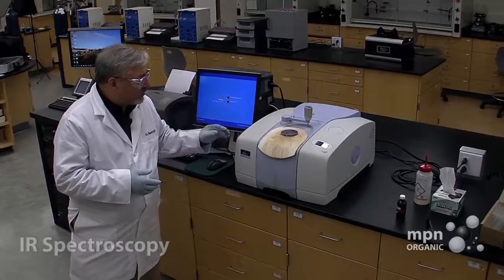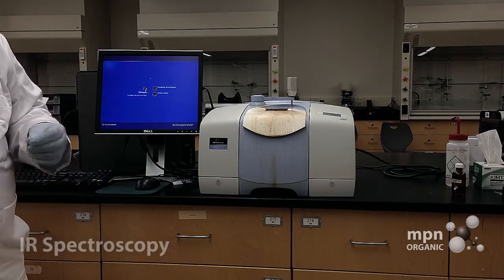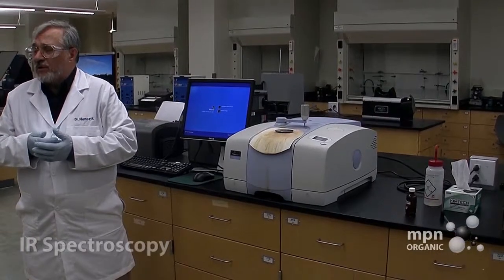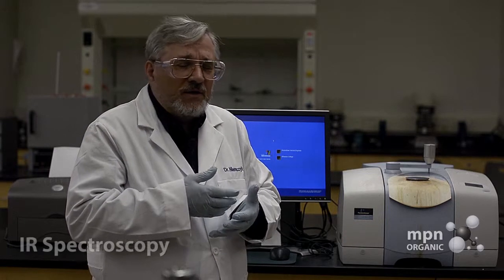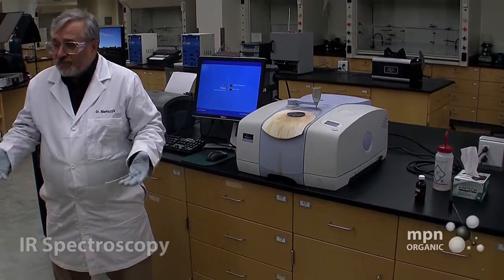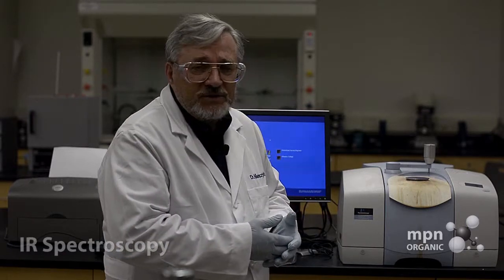And we have at our disposal here a Perkin-Elmer infrared spectrophotometer. This is really a great instrument, and it is very easy to take an infrared spectrum of an organic liquid. Now, what I say for an organic liquid is going to also obtain in most respects for an organic solid. There are a couple of interesting and important things that we have to do with a solid in order to determine the infrared spectrum of it. But what I say about a liquid is going to largely carry over to that of a solid, okay?